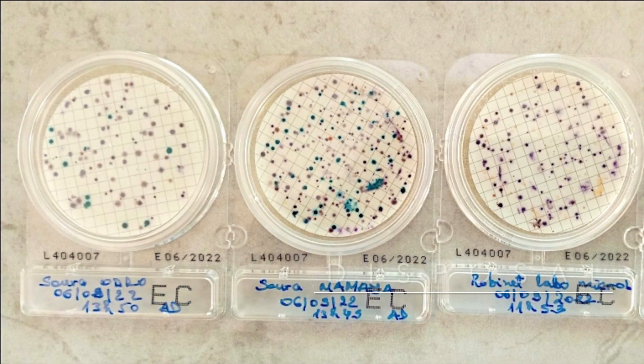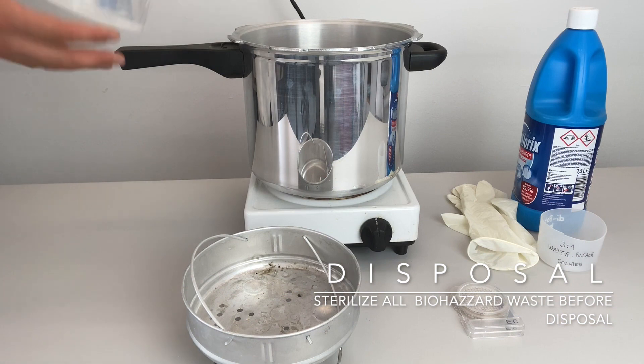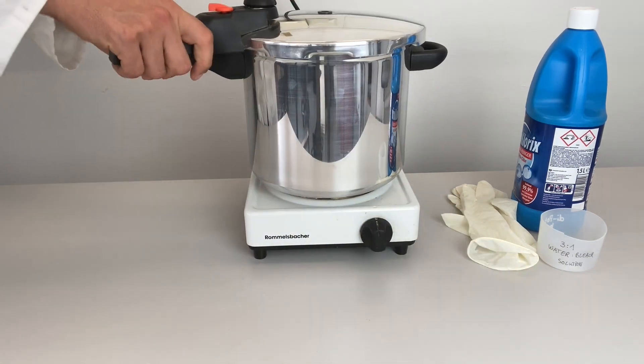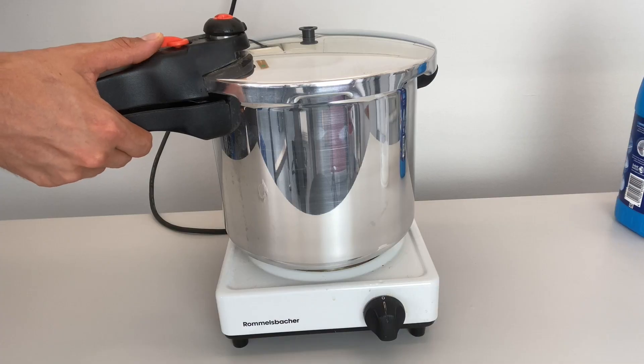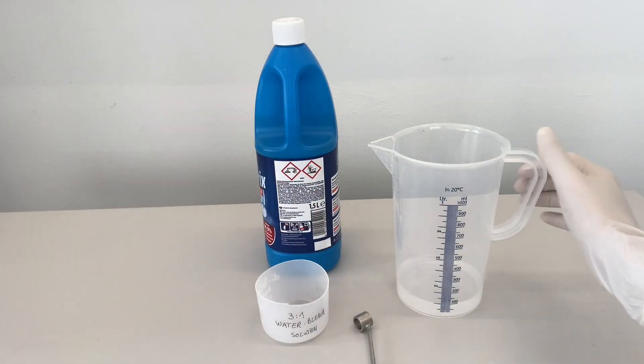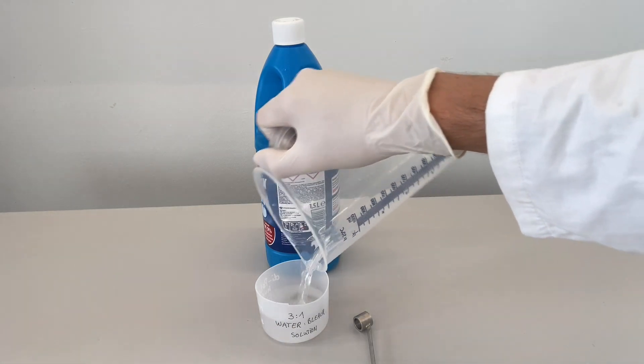Keep the plates always closed as the bacteria can be harmful to health. And make sure to sterilize all biohazard waste before disposal. This means autoclaving and or incinerating the plates to kill all bacteria grown on them. If this is not possible, use household bleach which will render them low risk.